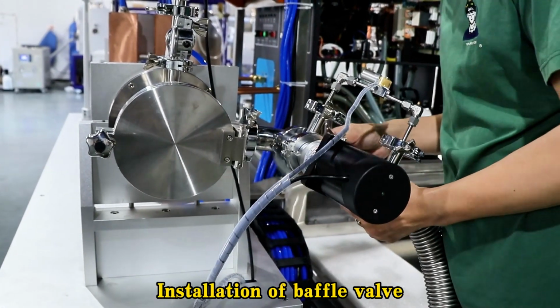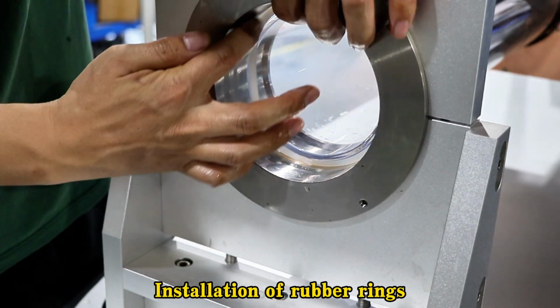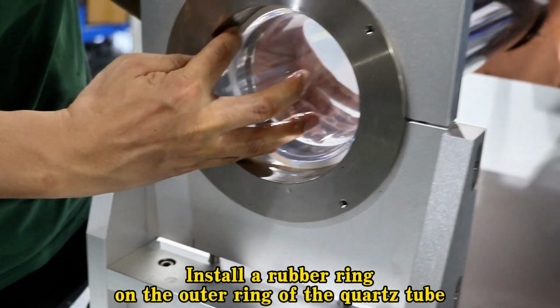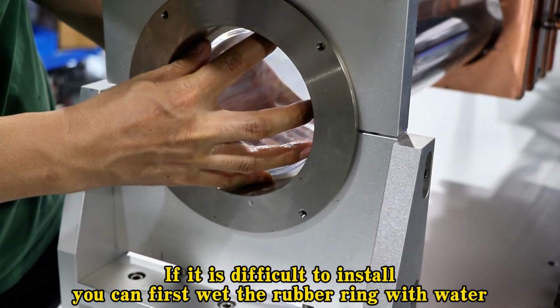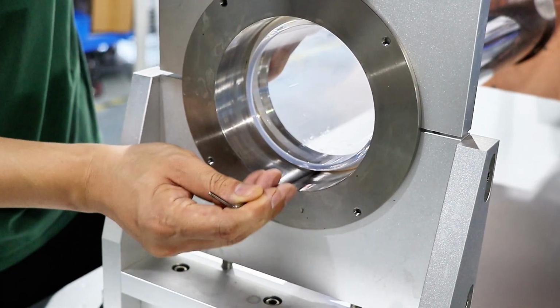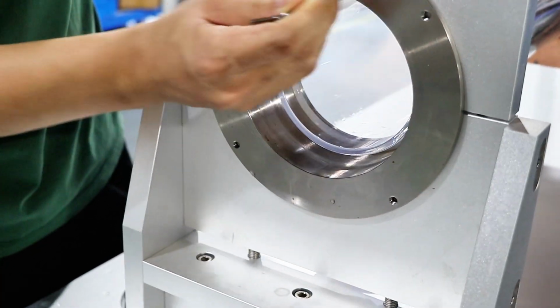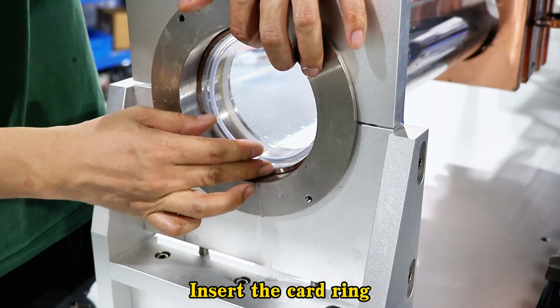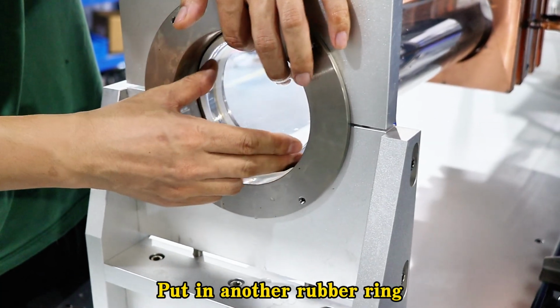Installation of baffle valve. Installation of rubber rings. First, install the quartz tube. Install a rubber ring on the outer ring of the quartz tube. If it is difficult to install, you can first wet the rubber ring with water. Insert the retaining ring. Put in another rubber ring.